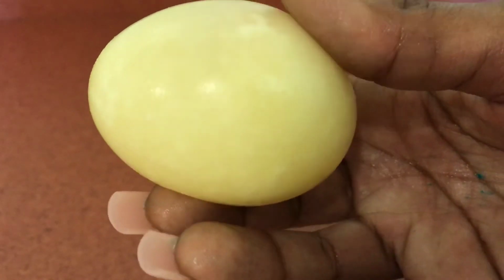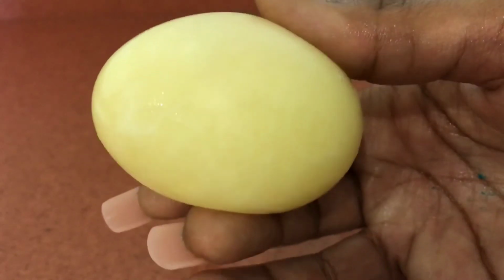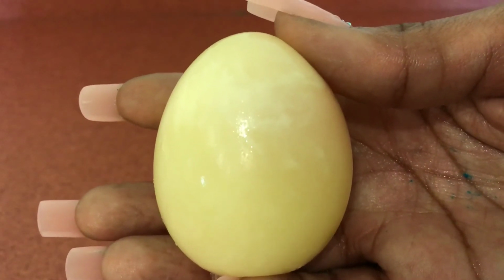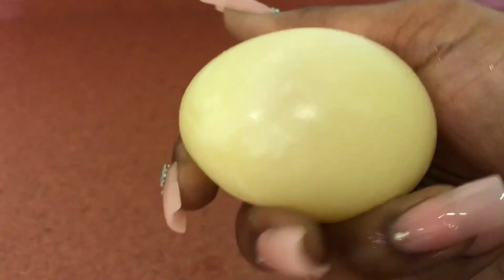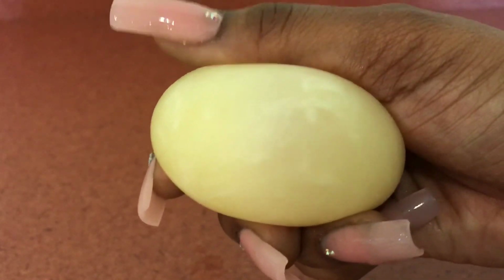I thought this was super cool. It's definitely got a bounce to it, just like our original translucent osmosis egg, but it's definitely different. It's got a little bit harder perimeter, still squishy, but a little more tougher on the outside, which was why I was able to squish it so much. It was super fun. But that is all of our eggs.